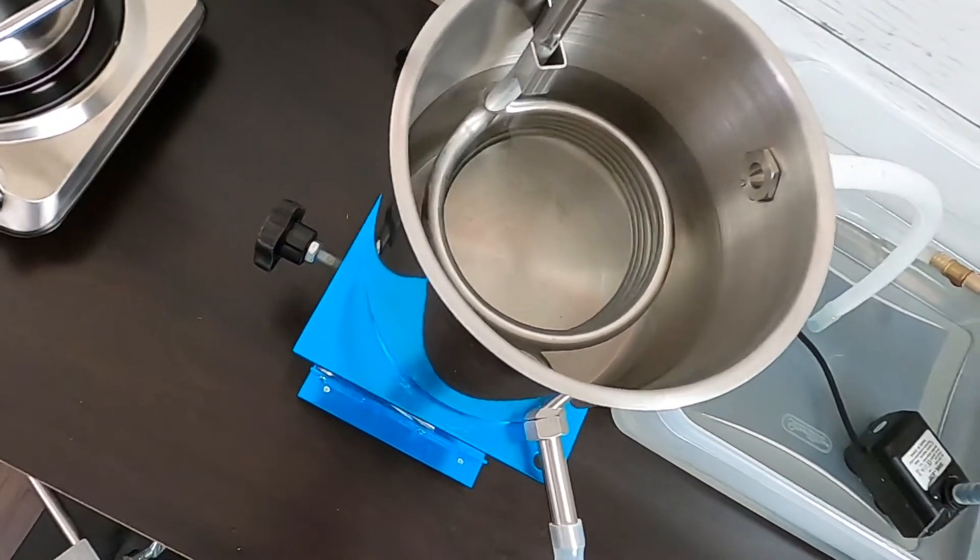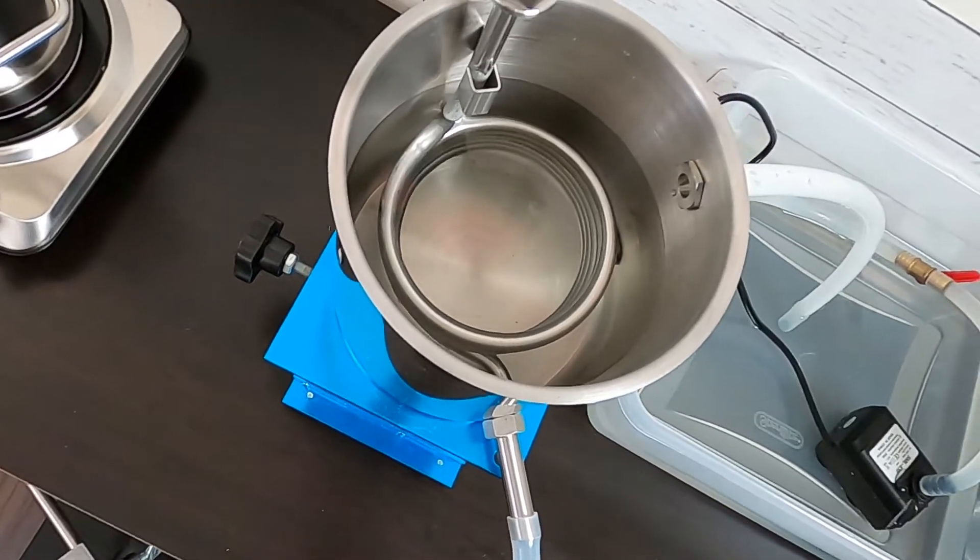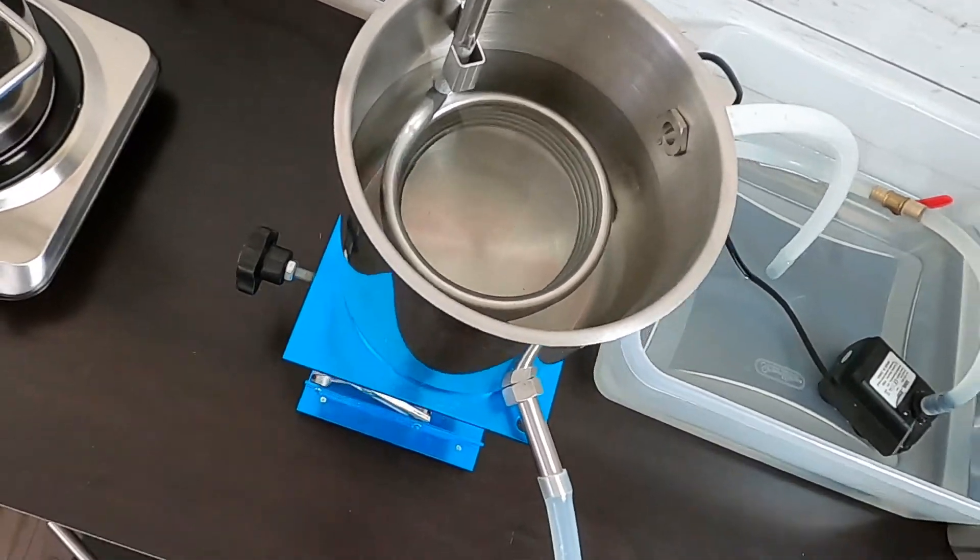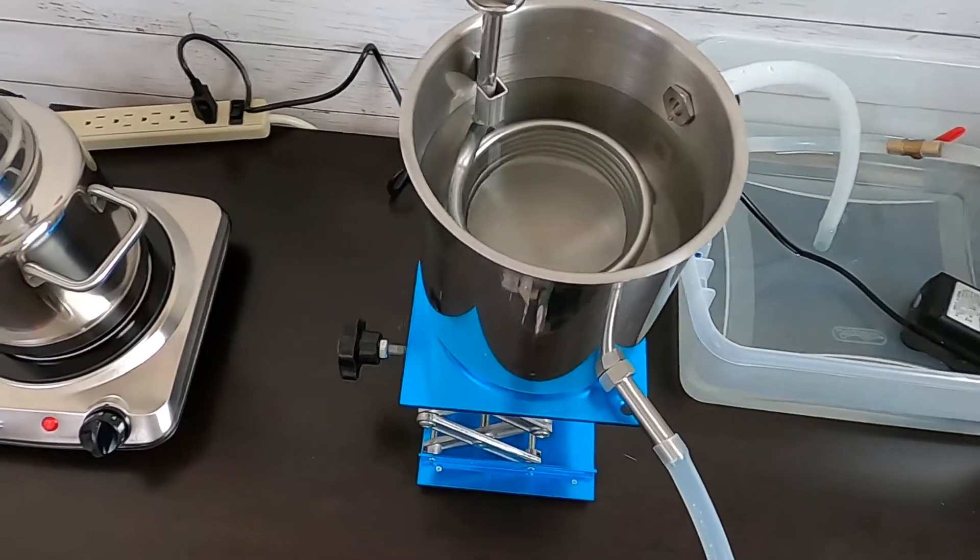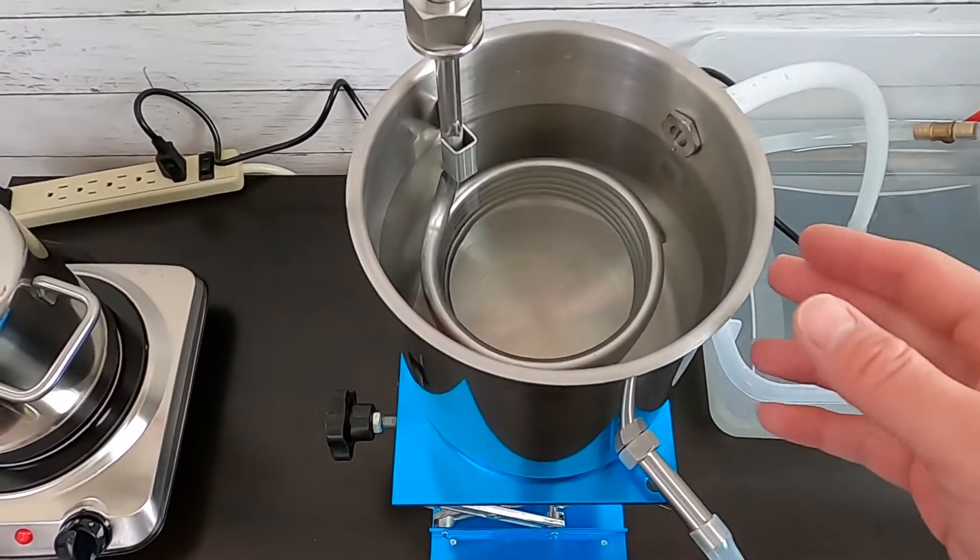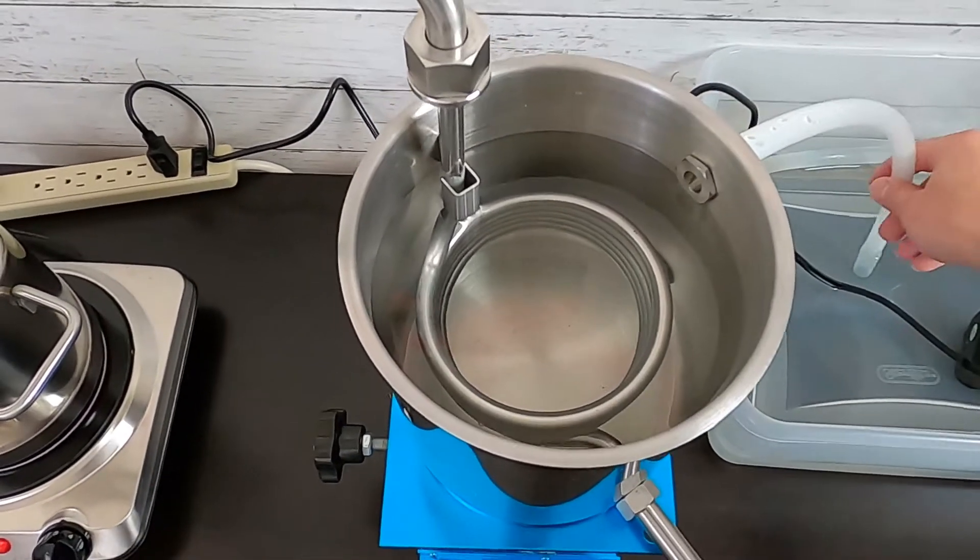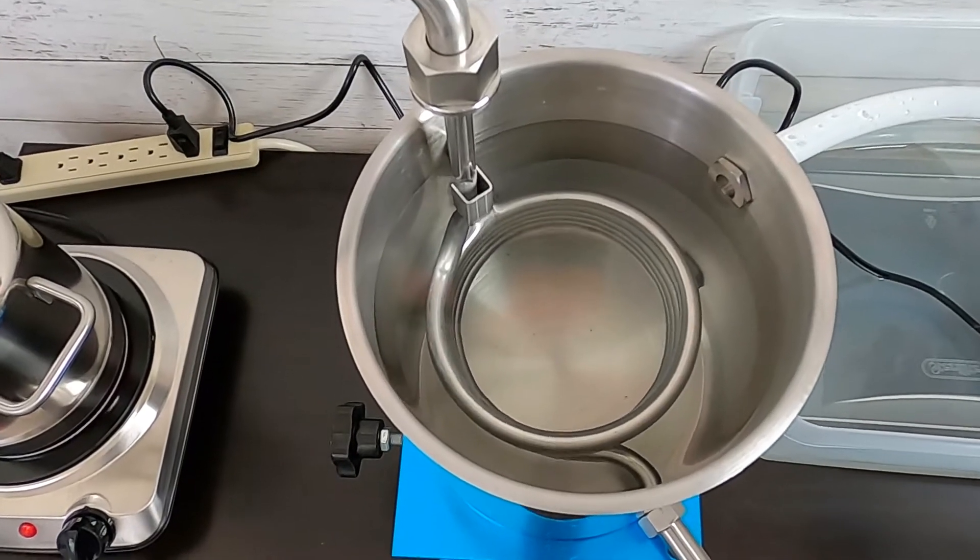And you don't need a very high flow rate. Because the benefit of this large reservoir, you have a lot of cooling opportunity, cooling power.